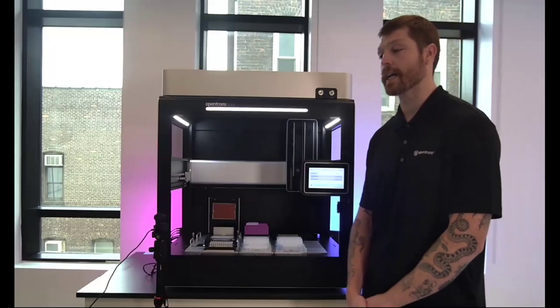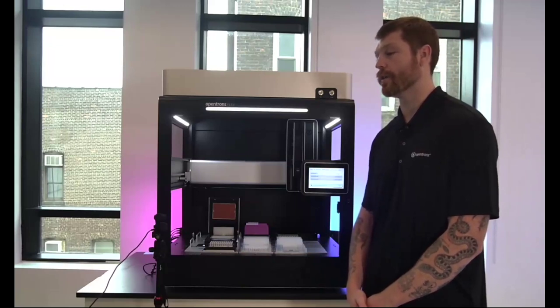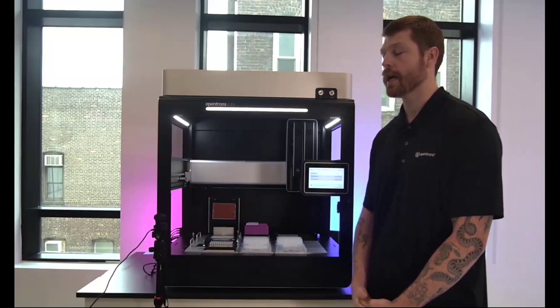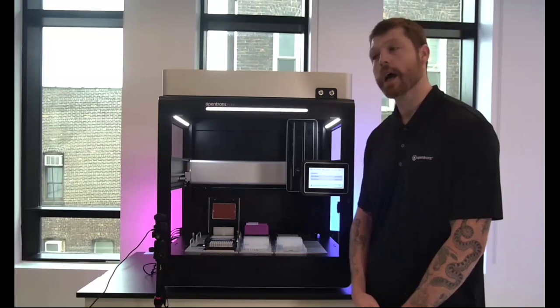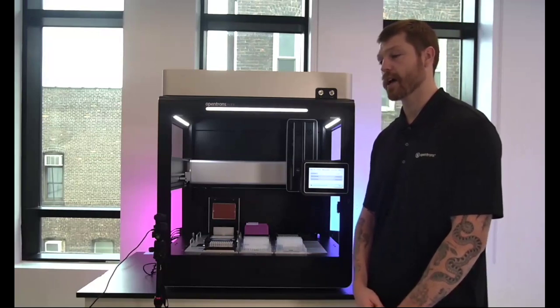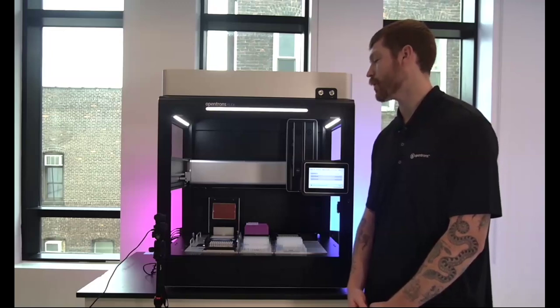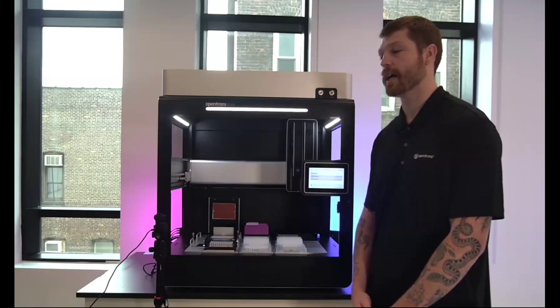Okay. First question, how customizable is the error recovery workflow? Can we have a custom error message and suggested recovery path? Yeah, so currently they're going to be pretty guided workflows. So it'll really be the basic error flow that you'll be seeing currently. If you wanted to have custom error messages, I don't think that's currently configurable. I don't think you can build out your own error workflows, but it is definitely a feature set that we've considered, as well as the fact that the logic does exist within our open source platform. So currently they're not configurable, but it's definitely a future-leaning ideal to have them as customer centric as possible.